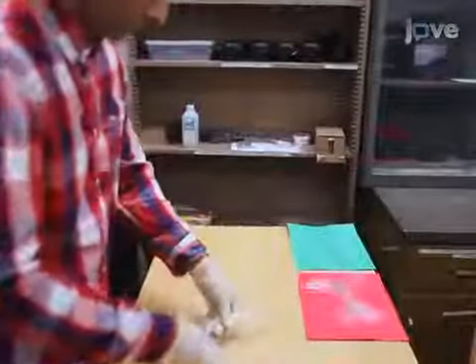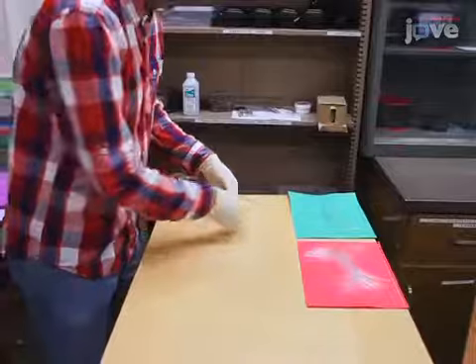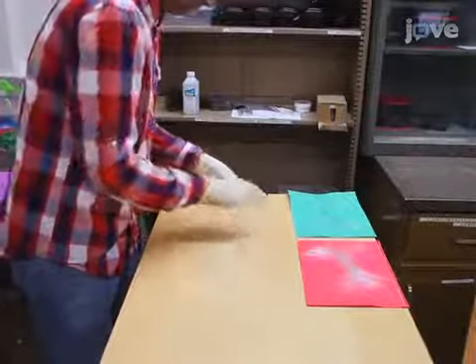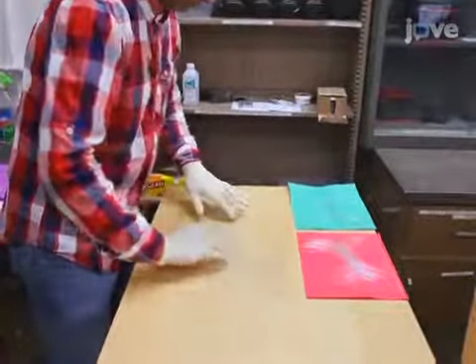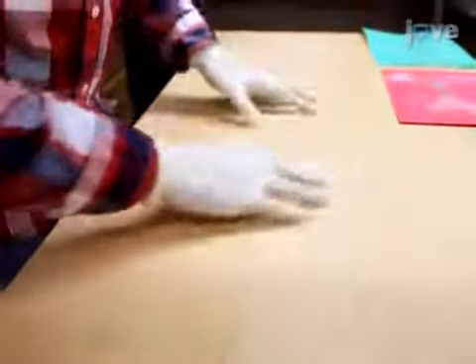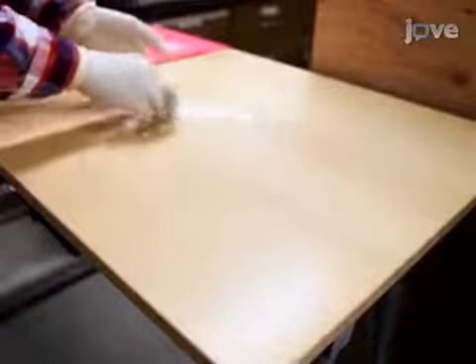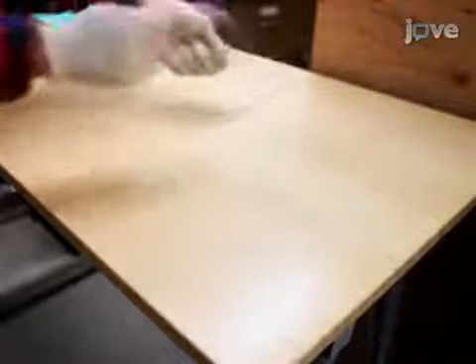Begin by spreading about 200 PMMA strands on a table, and then spreading the same number of polystyrene strands on top of the PMMA. Mix the strands together and then place them to one side. Repeat this procedure until 40,000 strands of PMMA are randomly mixed with 40,000 strands of polystyrene.